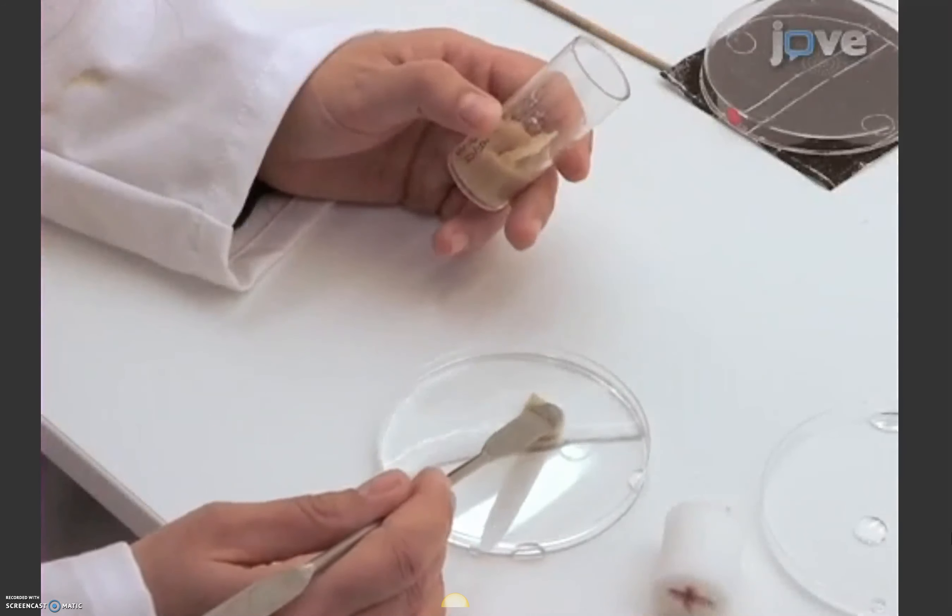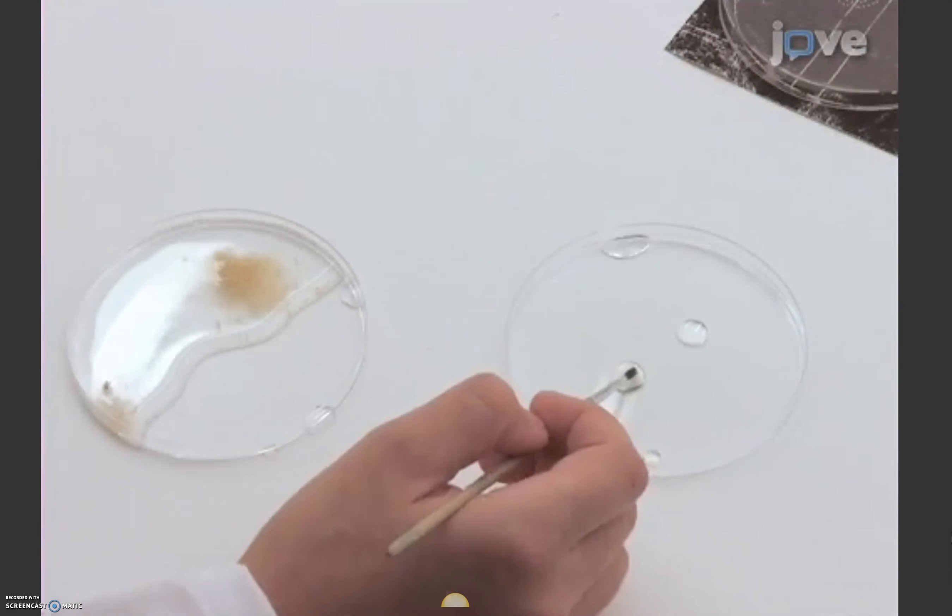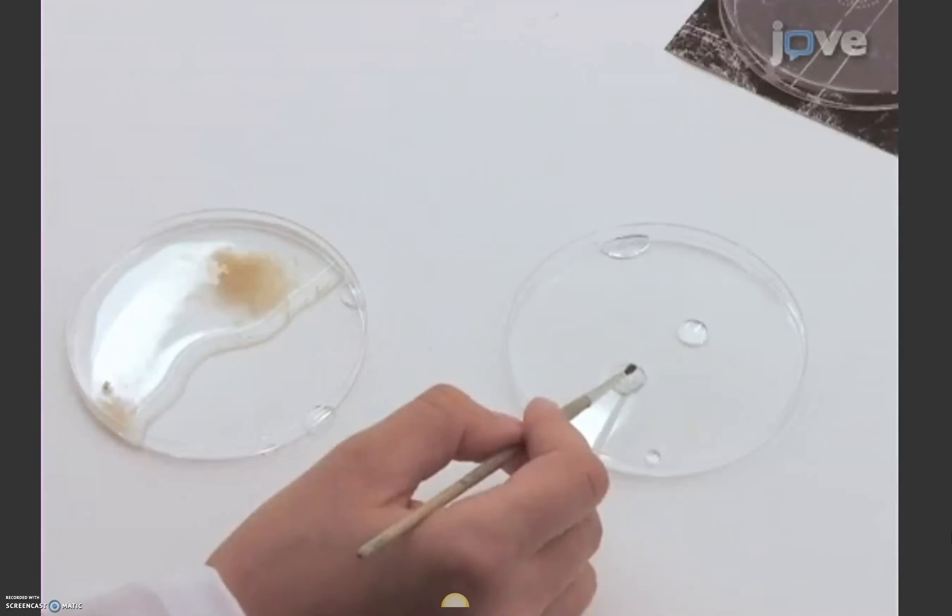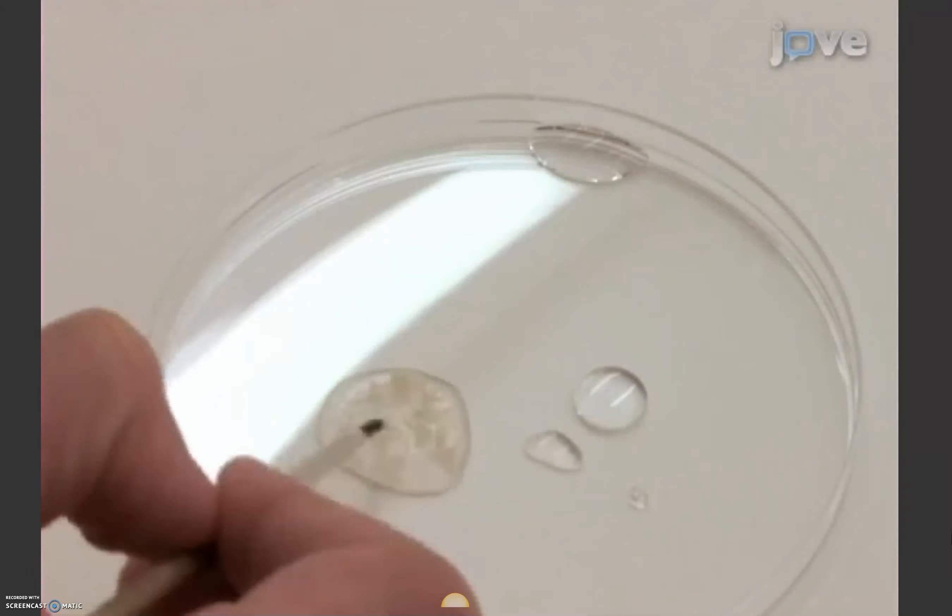Several control tests are required to determine whether transgenic animals have normal odor and processing for the reward stimuli. The test for naive odor preference begins with collecting and washing 30 larvae as done for the training and testing.